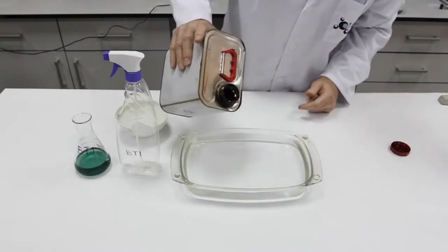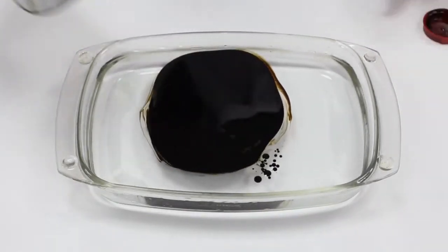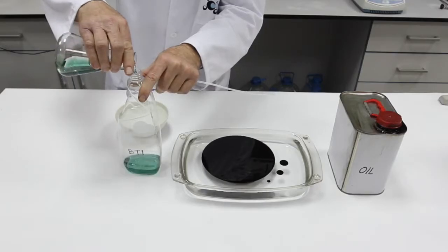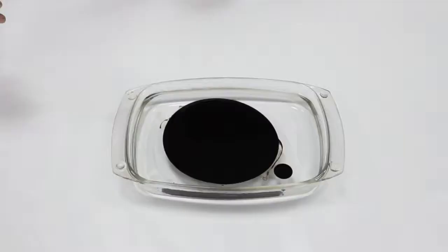The lab technician has filled a glass tray with water to simulate a marine ecosystem. Crude oil is then poured over the water's surface to generate a spot with an extension of 15 centimeters. The technician fills a spray bottle of BTI solution and applies it over the crude oil spill area. The extension of the crude oil spill vastly shrinks in size in reaction to the BTI chemical.